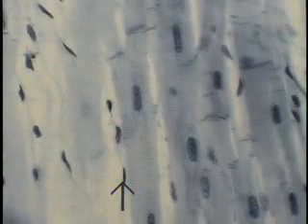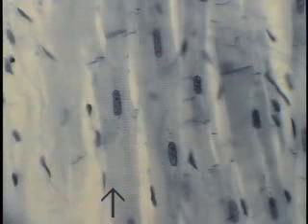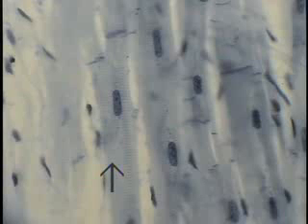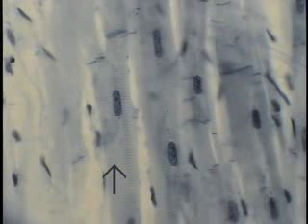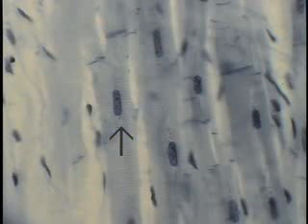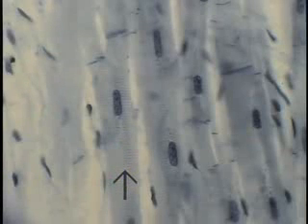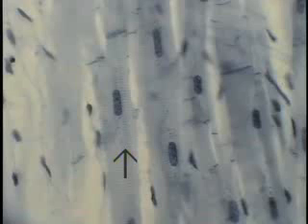Once again, this is a special preparation of cardiac muscle, simply used to demonstrate the banded pattern, the striations, as one can see at the edge of the arrow on this particular muscle type. Review the elements of cardiac muscle, namely, it has a centrally positioned nucleus. It does have myofibrils that show this banded appearance, so one can see the A and I bands quite readily on this particular preparation. Note that this particular cell or fiber is branching.